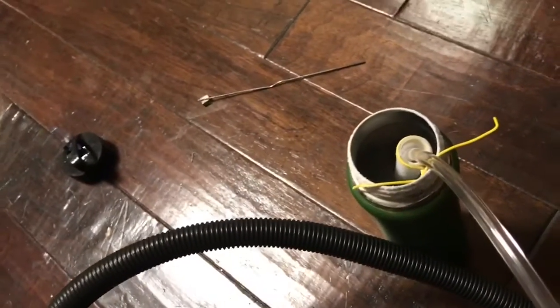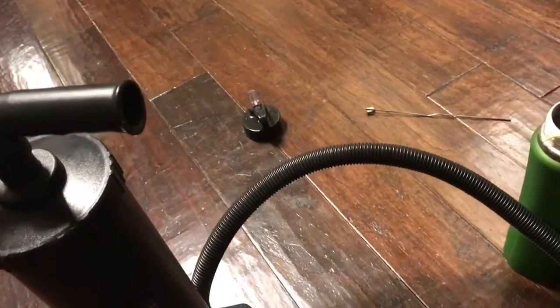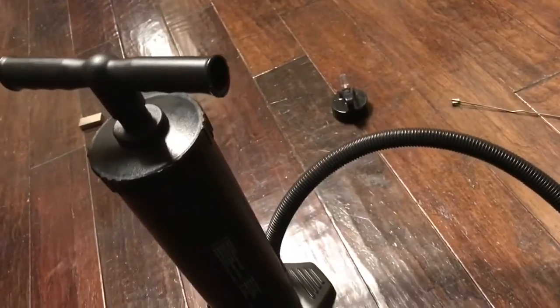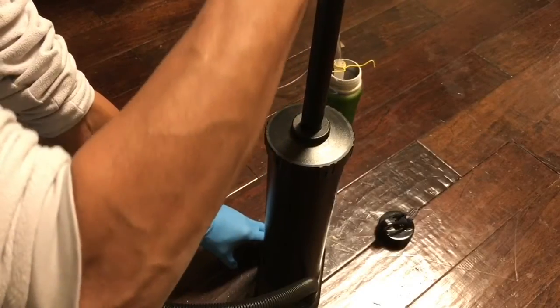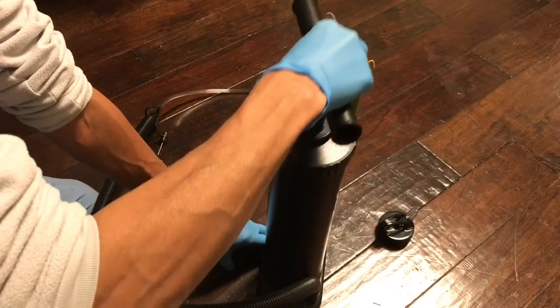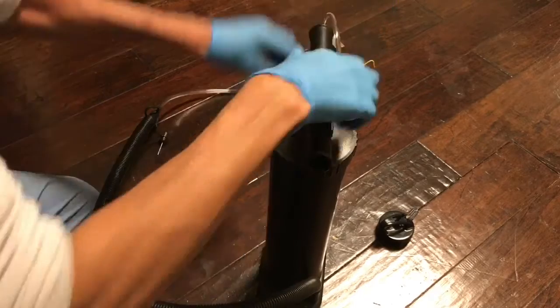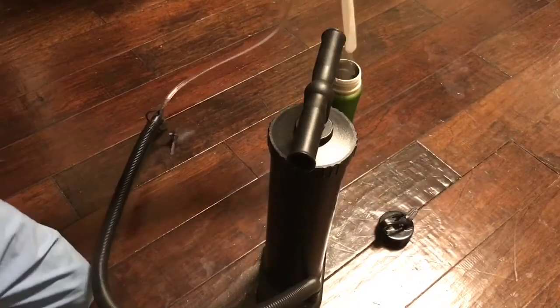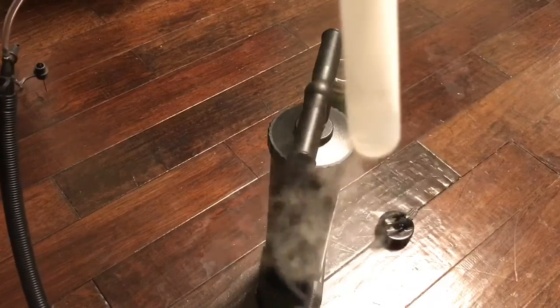Slowly pump the air through the tube so that it passes around the cooled test tube. It condenses out the oxygen — oxygen has a higher boiling point than liquid nitrogen, so it condenses first. I've pumped it a few times already, about 20 times, slow pumping like this.